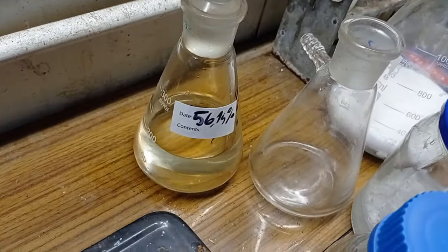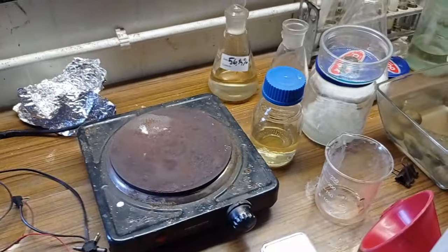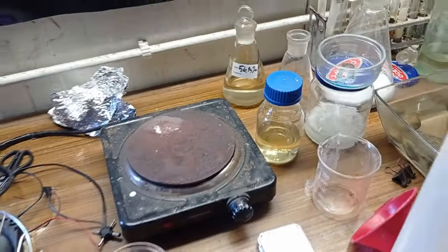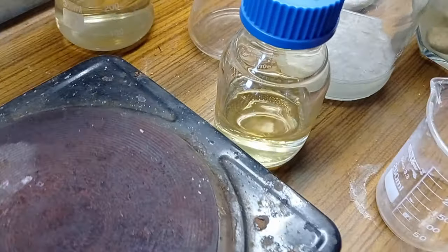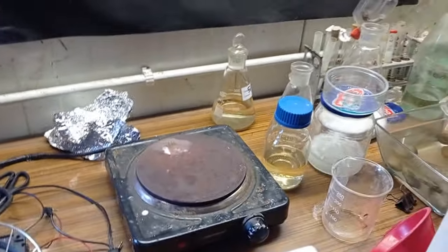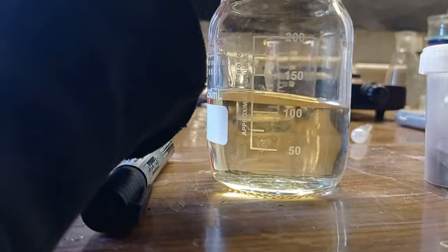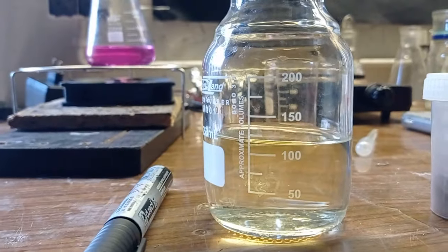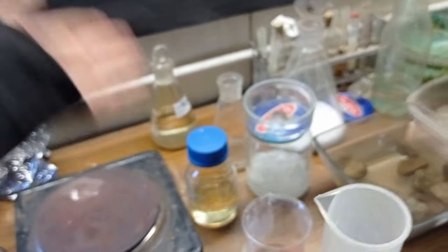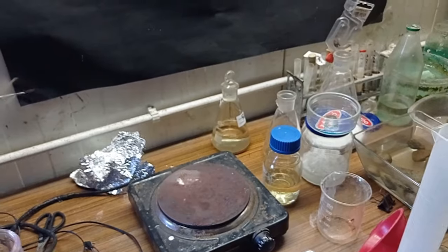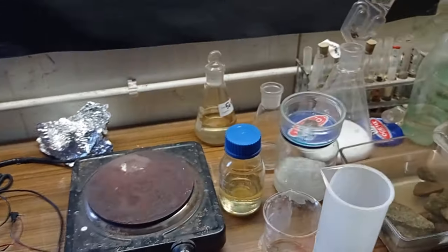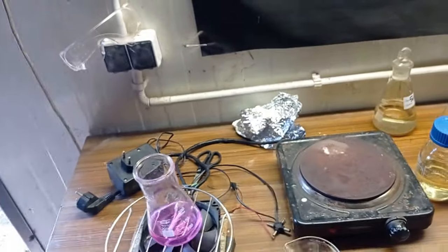With this one there might be a problem, but yeah, I'm very happy with it. Almost around 200 milliliters of concentrated nitric acid and 115 milliliters of very concentrated acid. I don't know what the yield is because I'm too lazy to calculate it, but yeah, I'm pretty satisfied.